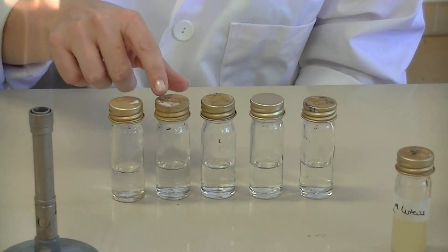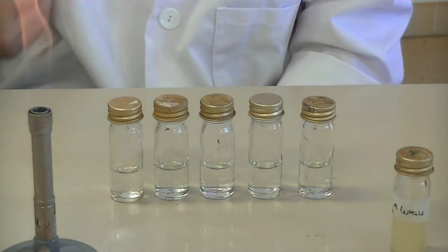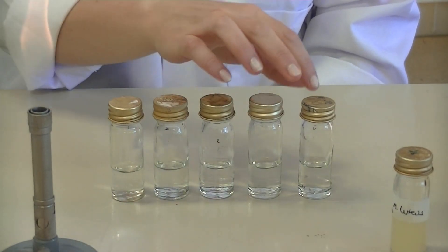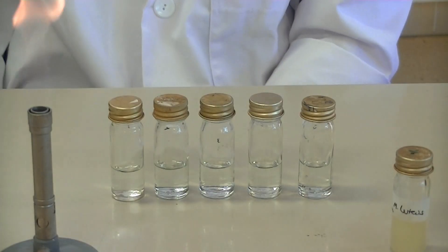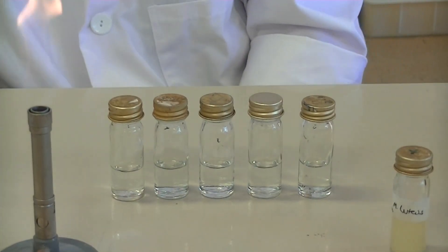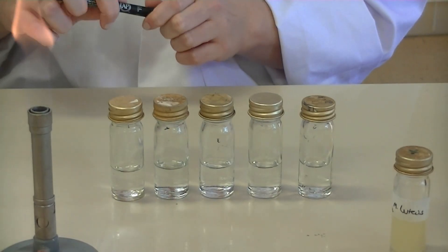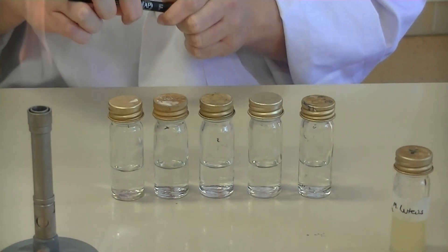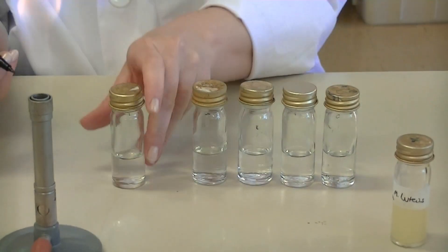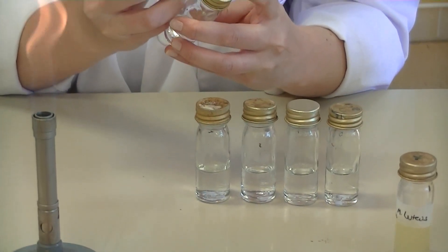We're going to perform 10 to the minus 1 dilutions — that is, 1-in-10 dilutions — from 10⁻¹ to 10⁻⁵. The first thing you should do is label each of the McCartney bottles with the correct dilution factor, so grab your marker and label each of the bottles.